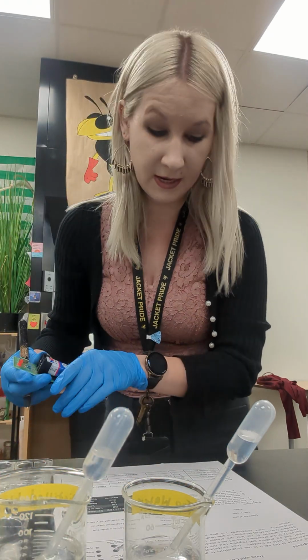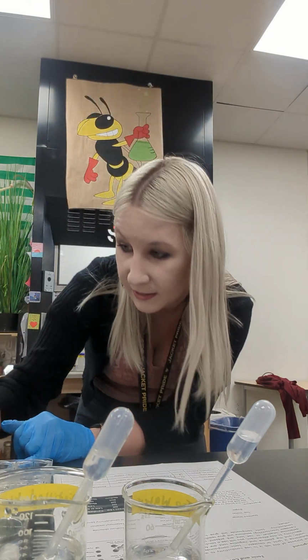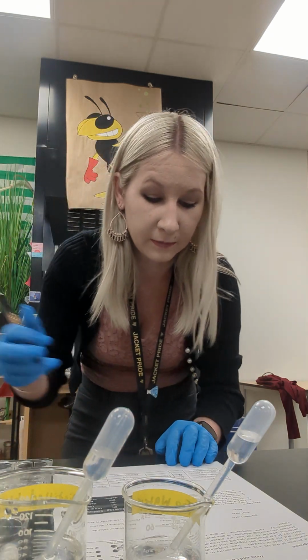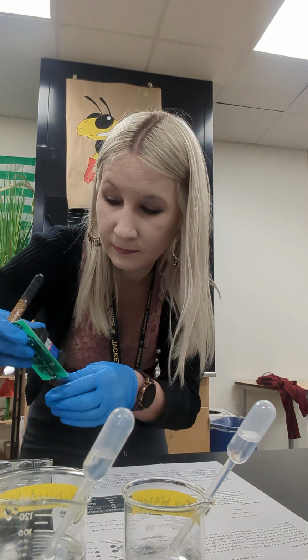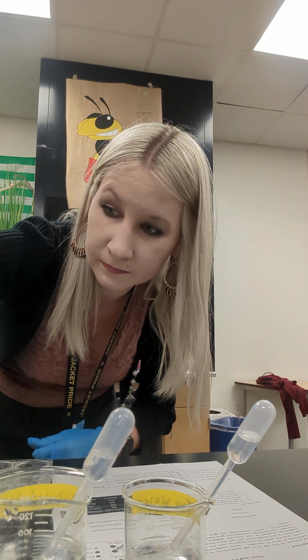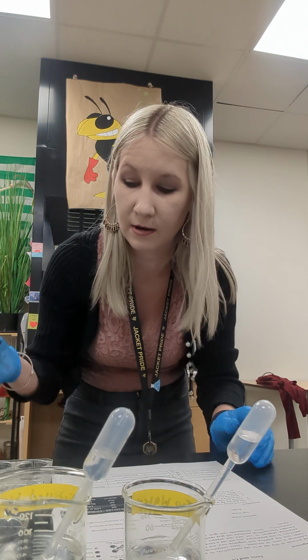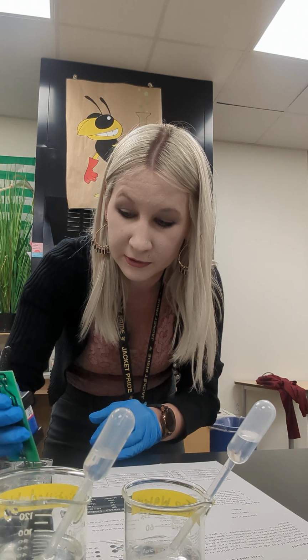I'm going to start with the copper sulfate, which is the next in our table. Copper sulfate is giving me a green and red light. That's a 4 on the rating scale. Magnesium sulfate, also a 4. Make sure that your indicator light is not on in between readings. Next in the table we have sodium chloride, also a 4.